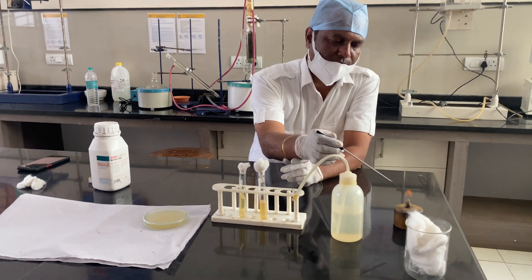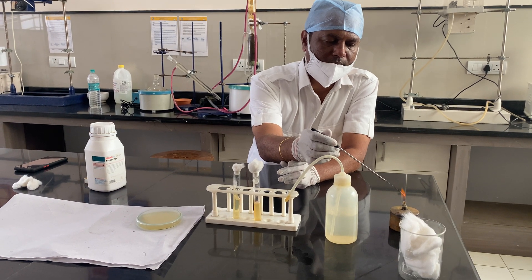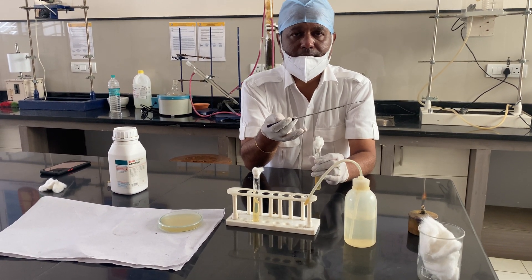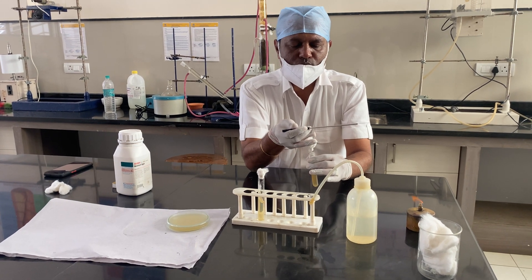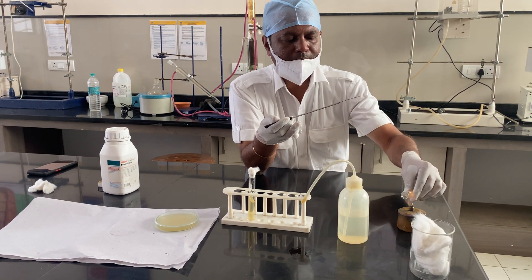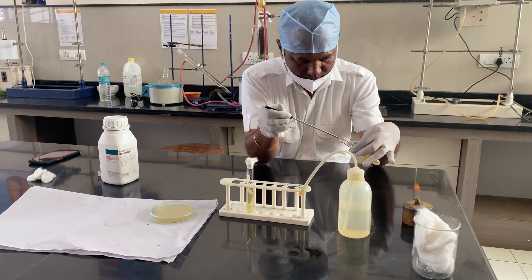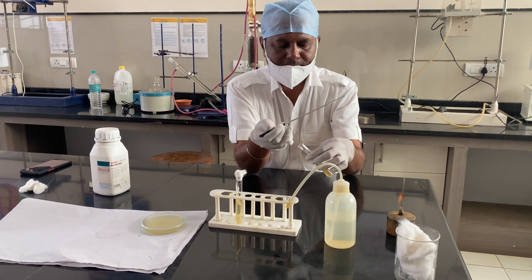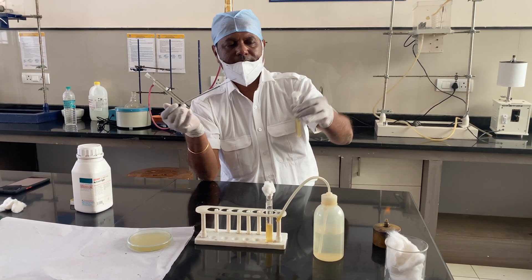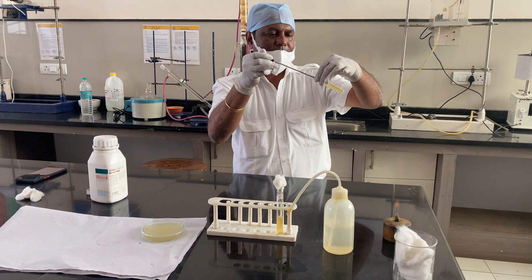If the loop is red hot and you immediately put it into the sample, it will disturb the sample because it is too hot. So, slowly remove the cotton plug from the test tube, pass the tube mouth through the flame, then use the sterilized loop to withdraw the sample. Without touching the sides of the test tube, transfer the sample to the slant, again passing the tube mouth through the flame before closing.